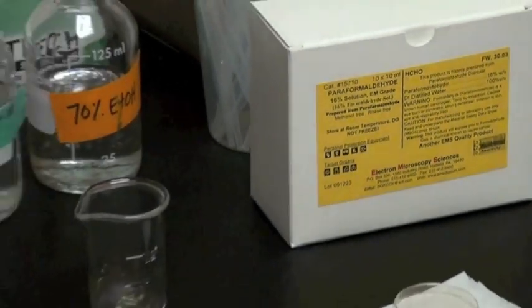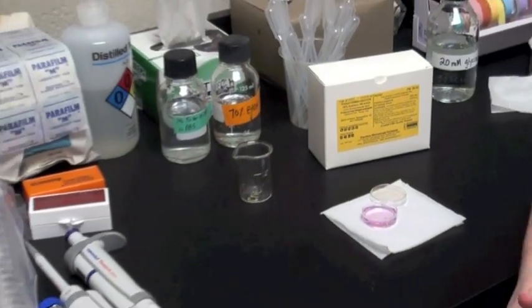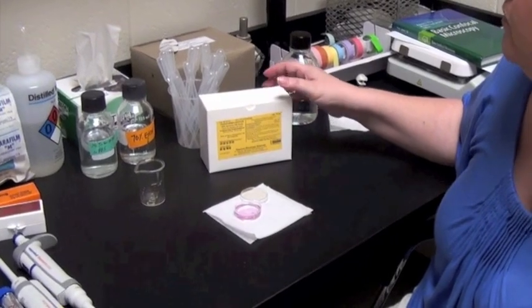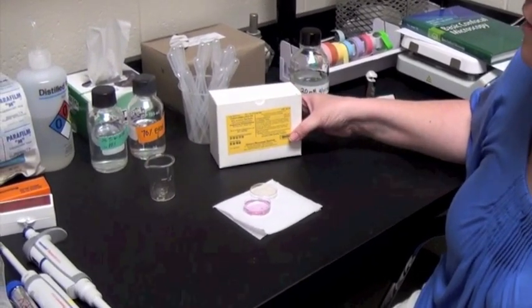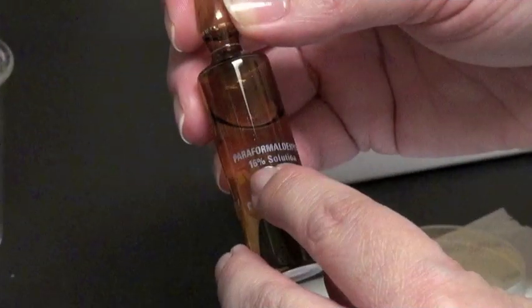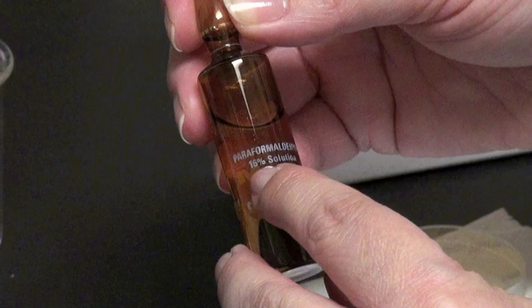You want your fixatives to be very fresh, otherwise they're not going to accomplish what you want them to do. As long as you get this solution as a higher percent solution than what you're going to use and it's in an inert environment, then it's great to use. This is a 16% solution. We use about a 4% solution of paraformaldehyde to fix our cells.